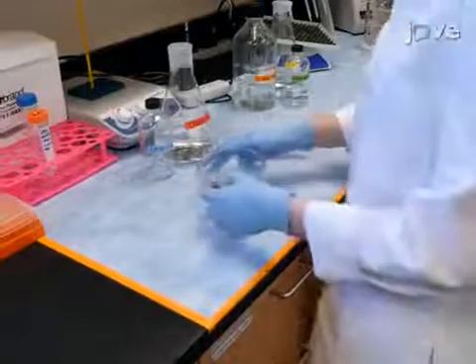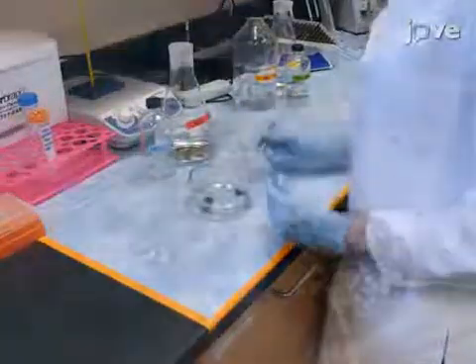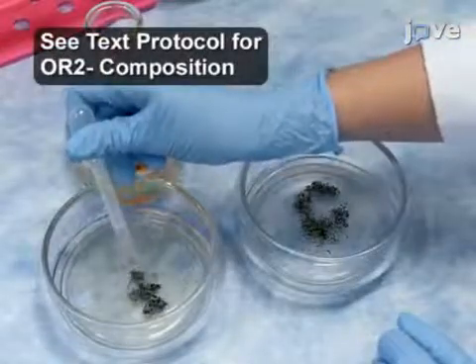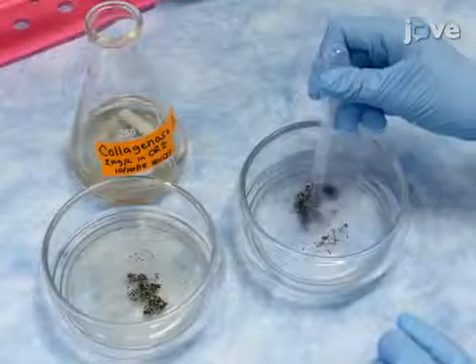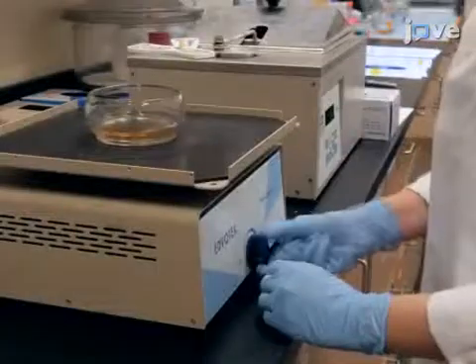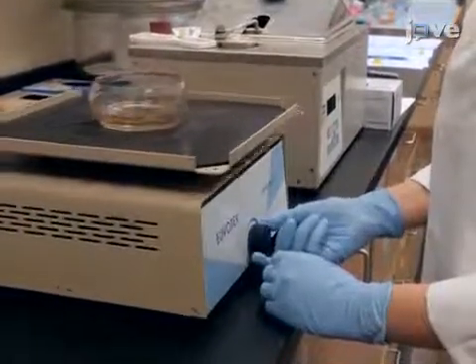After collecting ovarian tissue from anesthetized female frogs, tear the tissue into small pieces, each containing approximately 10 to 20 oocytes, and transfer these fragments first to fresh OR2- solution, and then to OR2- containing 2.0 mg per milliliter collagenase A. Continue by gently agitating the tissue-containing mixture on a shaker for one hour.